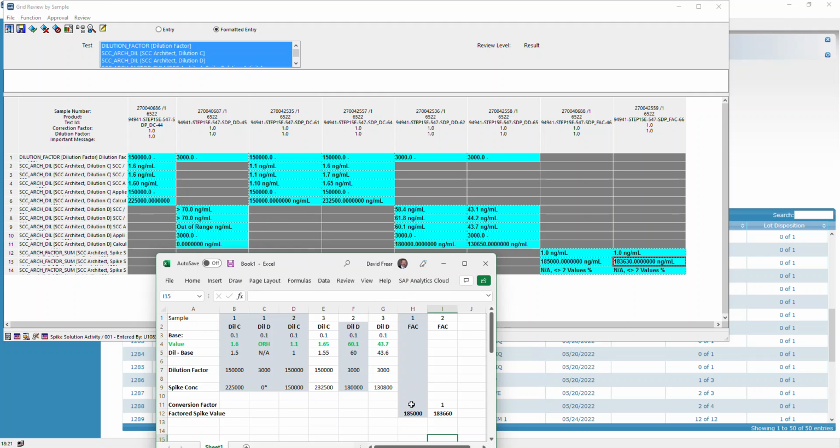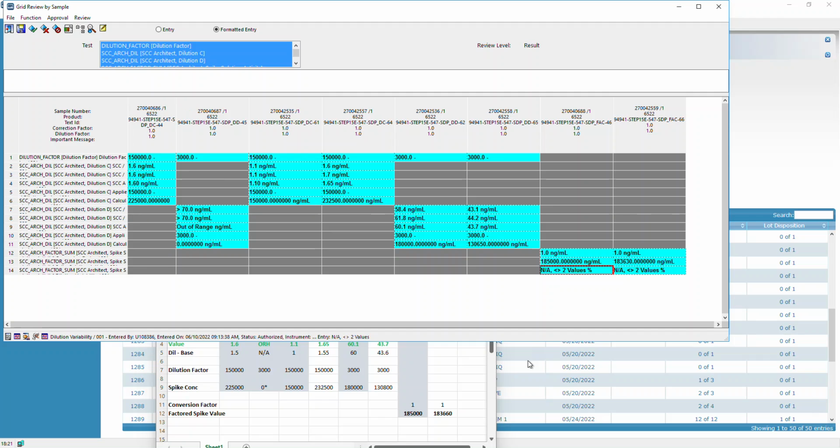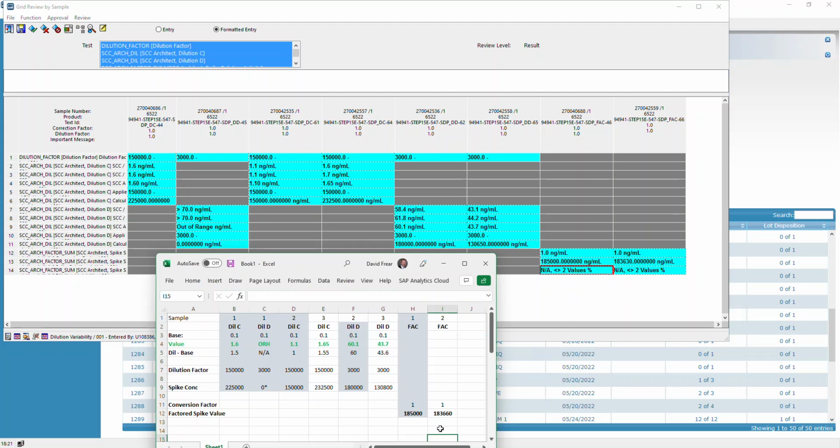And so that is why if you decided this original sample was not a good dilution, needs to be canceled, so it's not included in the summary calculation. And this is an example of the error you get when you have too many dilutions. If it's not equal to 2, it's going to give you this error, which is unfortunate because you kind of want to know how all of these line up. So I'll work on trying to fix that.